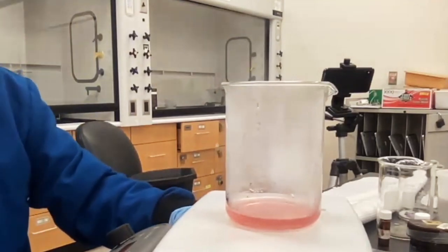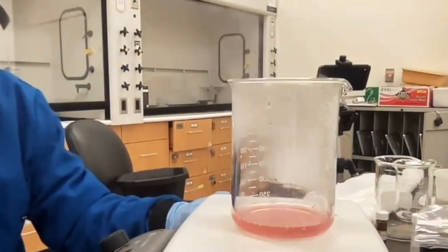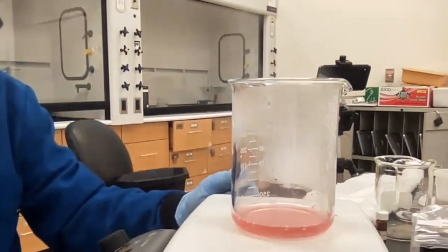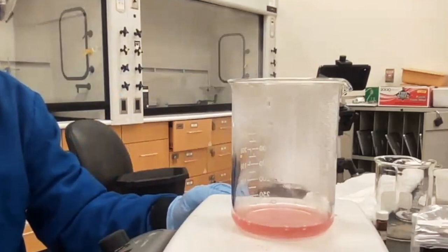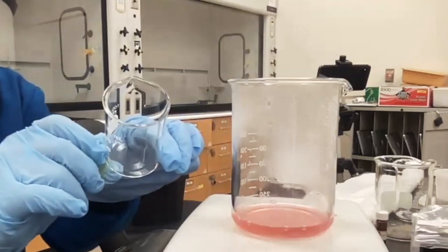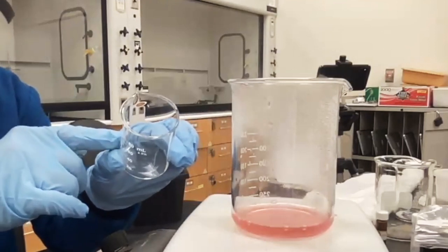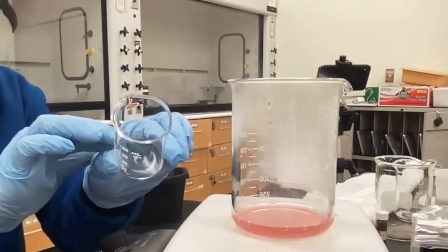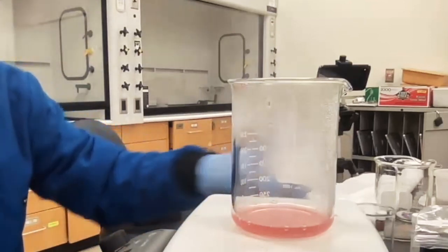Now I can hear this thing starting to boil. Here you can see that it's starting to boil now. And you want to use the biggest beaker. Why? Because the bigger surface area allows for faster evaporation. If you use the small one, like this, the surface area is so small, it'll take a long time for that to evaporate, because the water evaporation is only going to be as fast as the surface area that is there for the water to escape. Okay, that's why you need your largest beaker here.